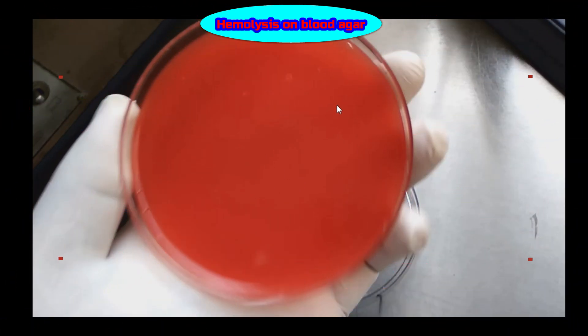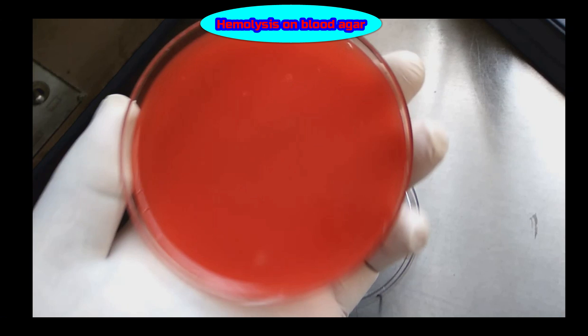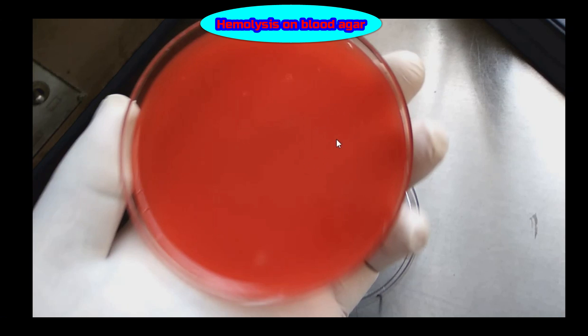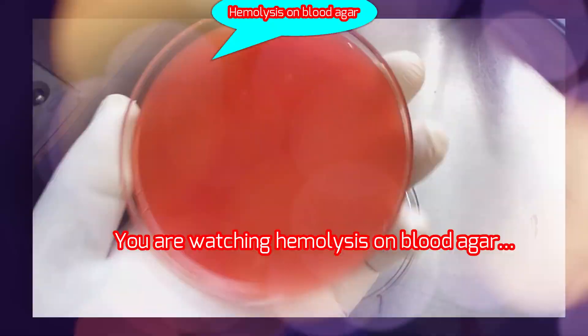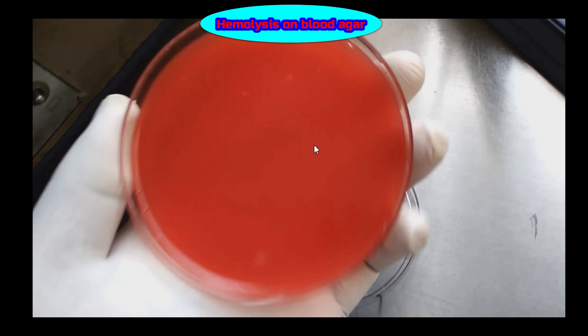In alpha hemolysis, there is a greenish discoloration around the colonies. In beta hemolysis, there is a clear, colorless zone of complete hemolysis. Whereas in gamma hemolysis, there is a lack of hemolysis around the colonies.